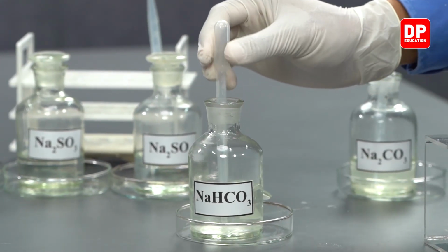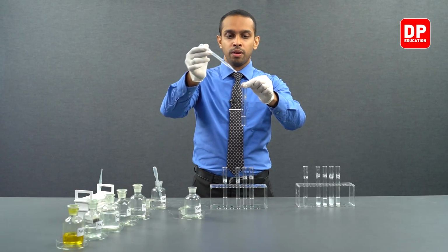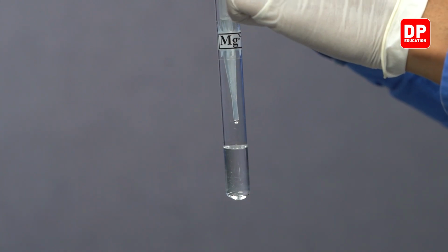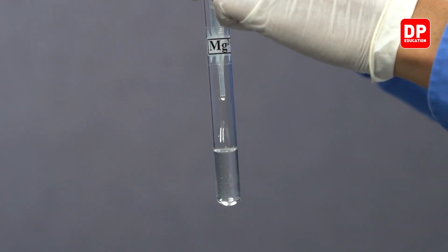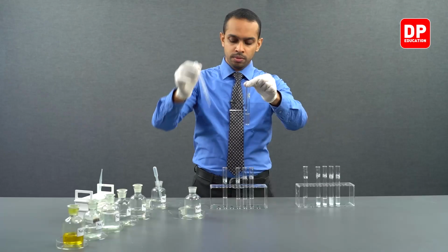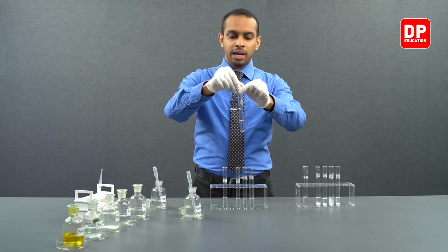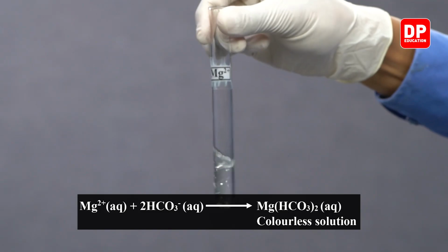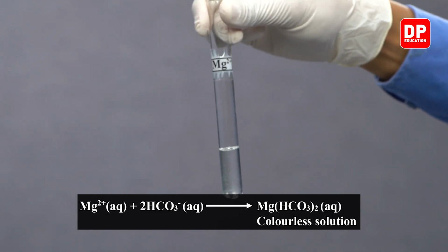Now, we will take a small amount of bicarbonate anion solution and add a few drops of it into magnesium 2 plus aqueous ion solution.